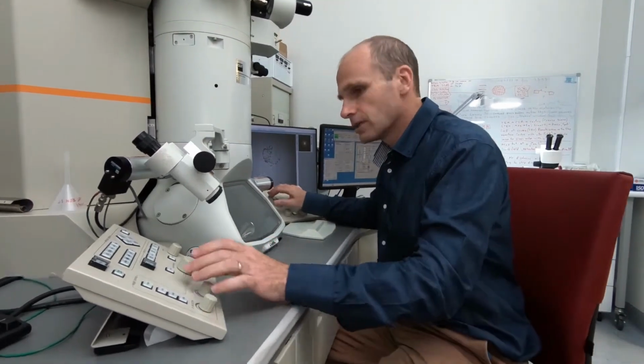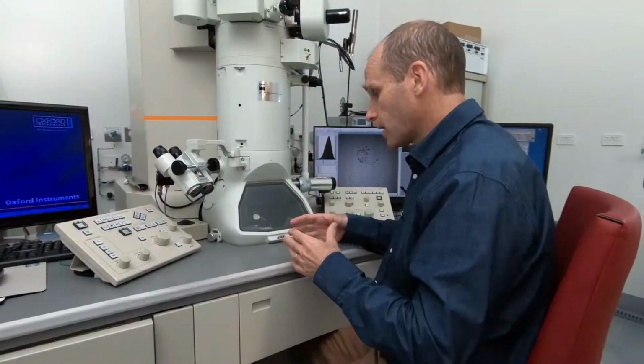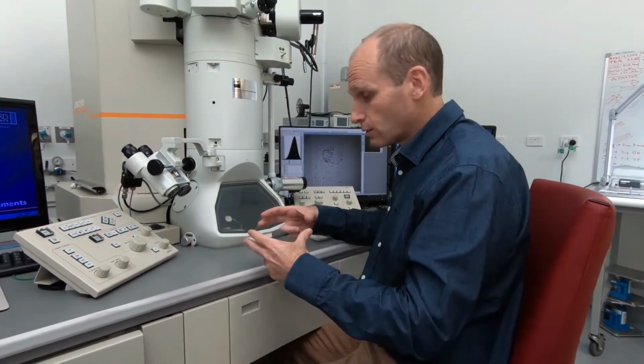Okay, so we've got a beam of electrons we can play with now, and first of all we want to look at our sample at a low magnification. If we put that up on the screen here, you can see the electrons are hitting the phosphor screen at the bottom and they're producing a green glow, which means that we can see our sample. What we can see on the screen at the moment are the black lines going across, and these are the copper bars in our 3mm grid that we were looking at before.